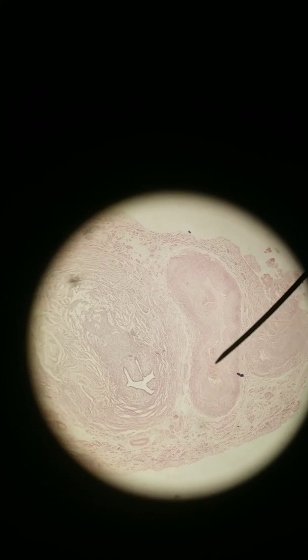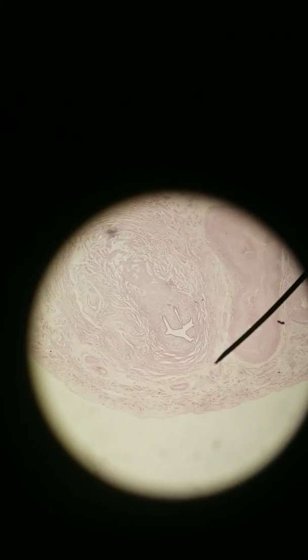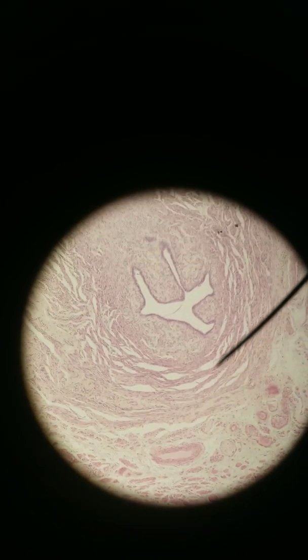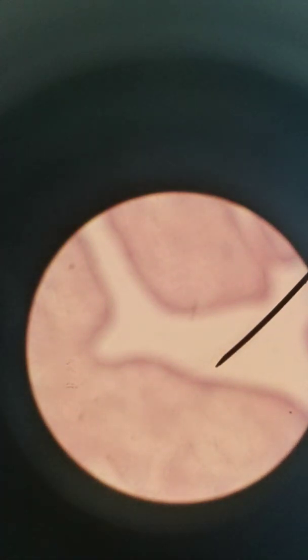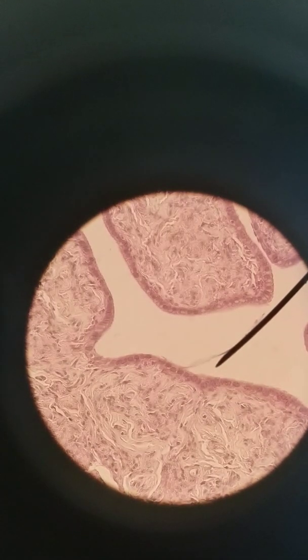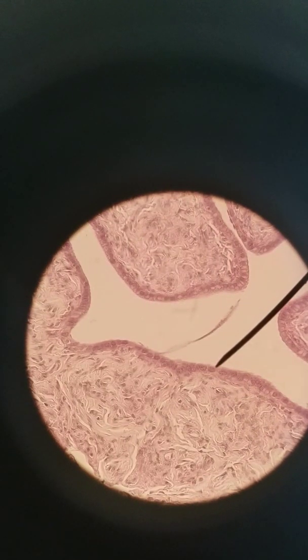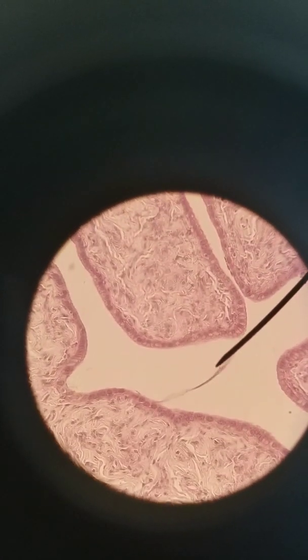When the egg is ovulated, it's released into the uterine tube, otherwise known as the fallopian tube. Here in the fallopian tube you can see the lumen right here at 40x, and you can see a lot of smooth muscle surrounding it. At 100x, there's lots of smooth muscle on the outside, some adventitia, blood vessels, and connective tissue. The epithelium is pretty interesting — it's one of the few places in the human body where we can find cilia. This is ciliated simple columnar epithelium, to help sweep the oocyte down the uterine tube into the uterus. The muscle helps push the egg or potentially fertilized egg along as well.